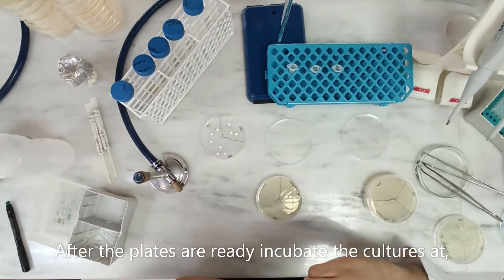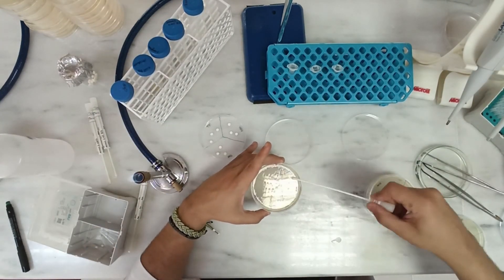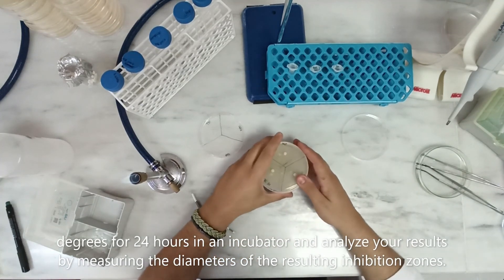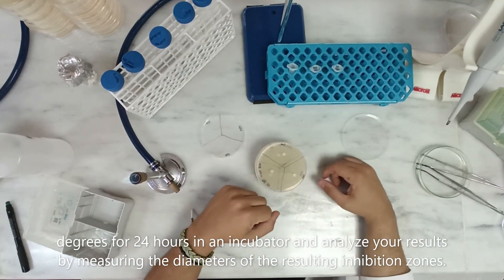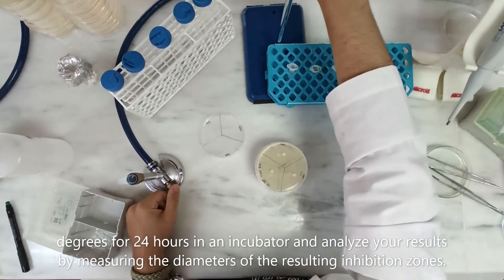After the plates are ready, incubate the culture at 37 degrees Celsius for 24 hours in an incubator. Analyze your results the next day by measuring the diameters of the resulting inhibition zones.